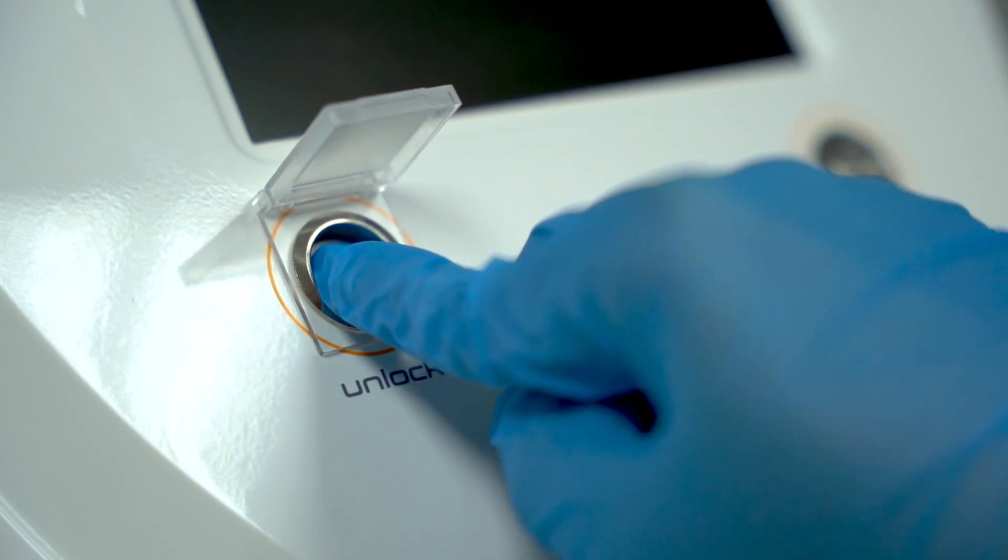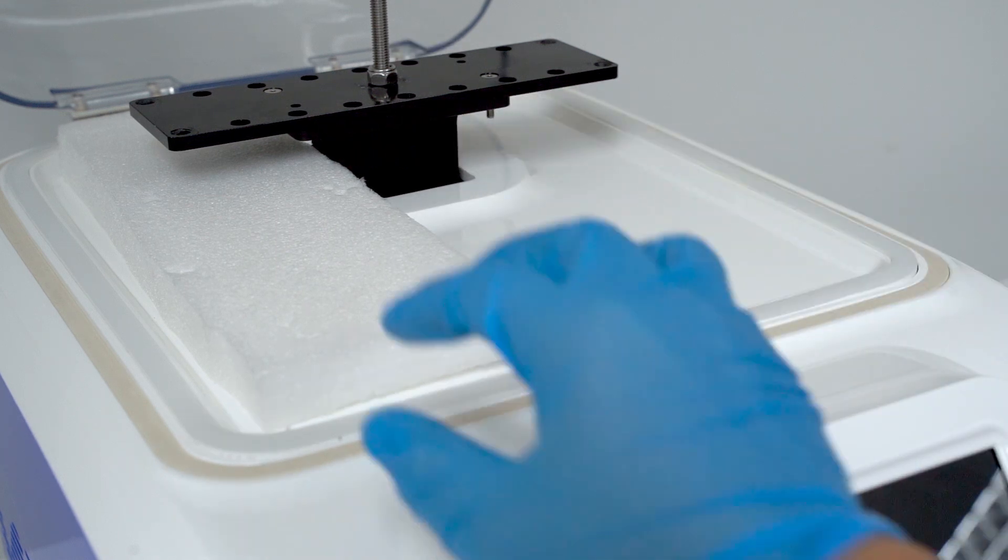Press the unlock button to open the dome and remove the internal protective foam.